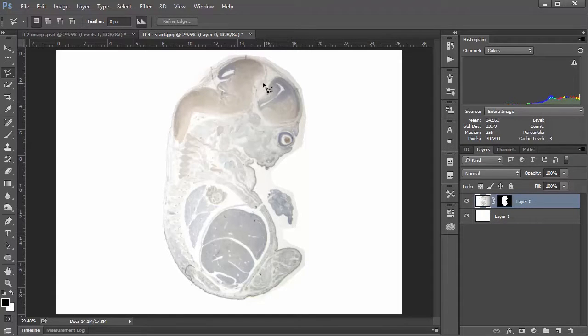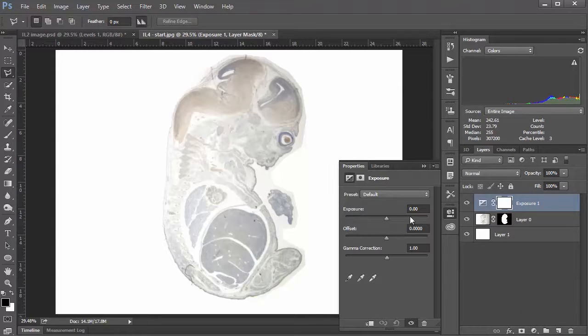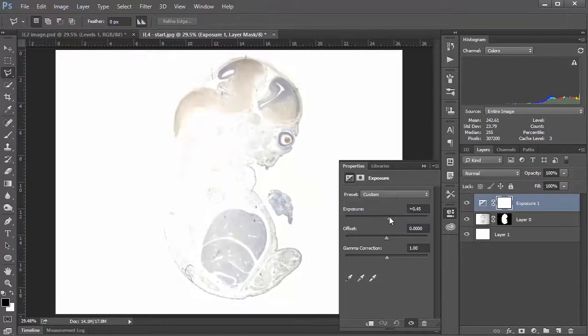Now, you can see from this image, the exposure is kind of off, moving from the left-hand side to the right-hand side. We're a little overexposed here and a little underexposed on this side. So what I'm going to do is create an exposure adjustment layer, and then put a gradient mask on it so that we're only exposing the one side. To show you how that works, first we go down to the Adjustment Layer button here, and we'll choose Exposure. I find with the exposure sliders, you really don't need to go crazy with them because they can get out of control pretty quickly.